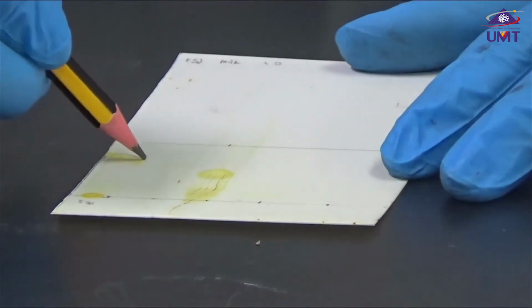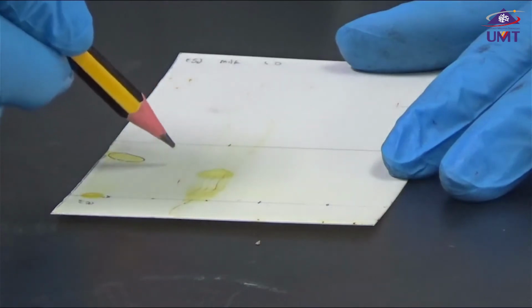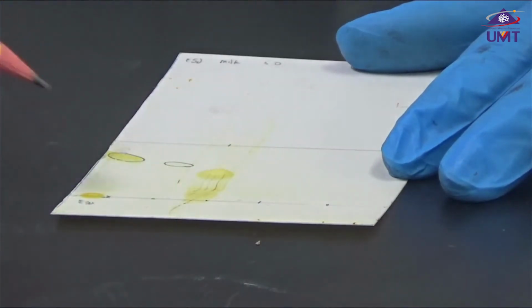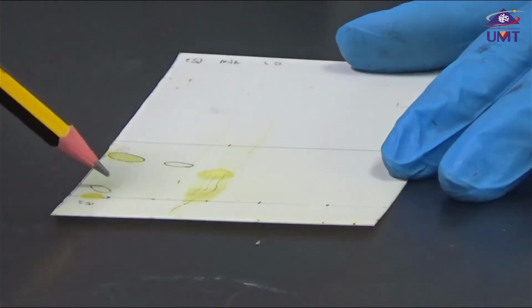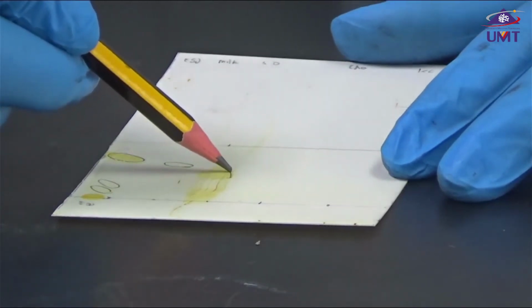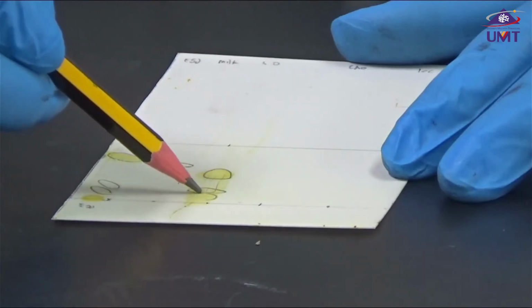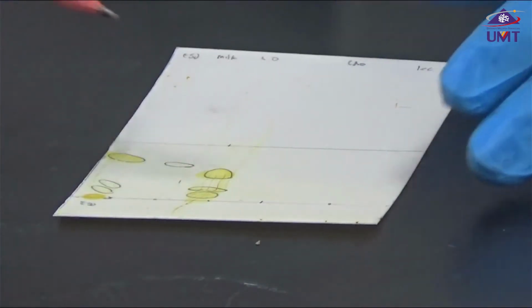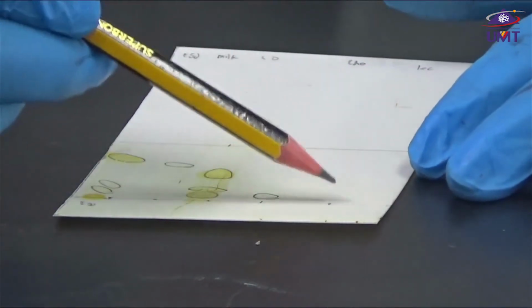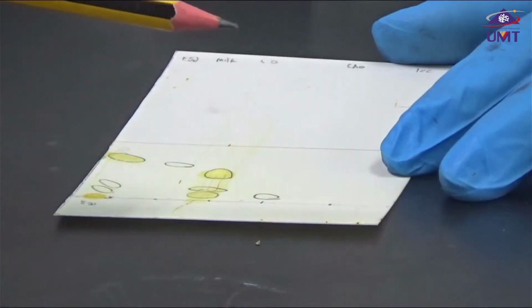We have this sample for eggs, the highest, the lowest. Then we have milk. At the same time, we also have this band for the eggs. And then we have the olive oil, and it has its own separation as well. And then we have this cholesterol. Unfortunately, we couldn't see any band formation on our lecithin.